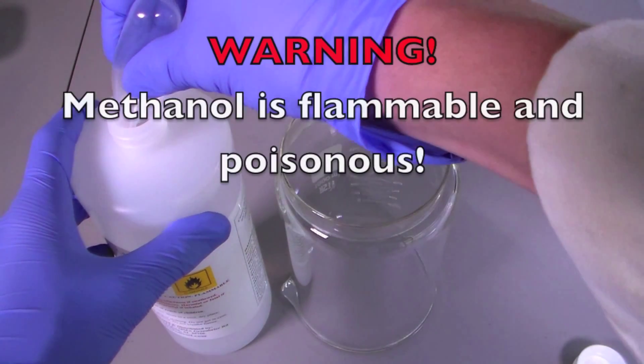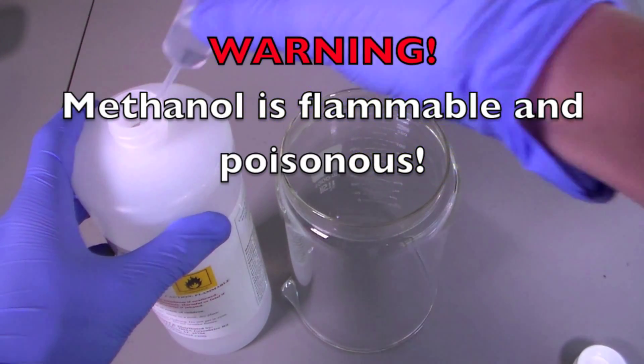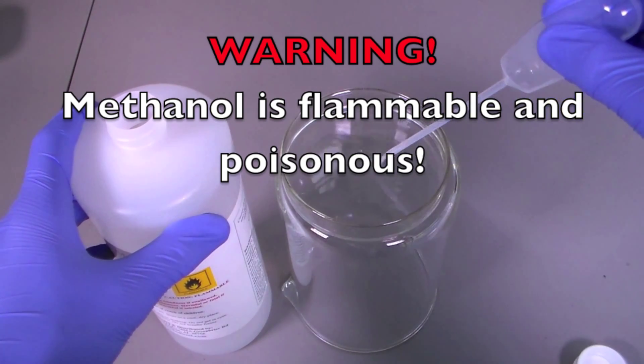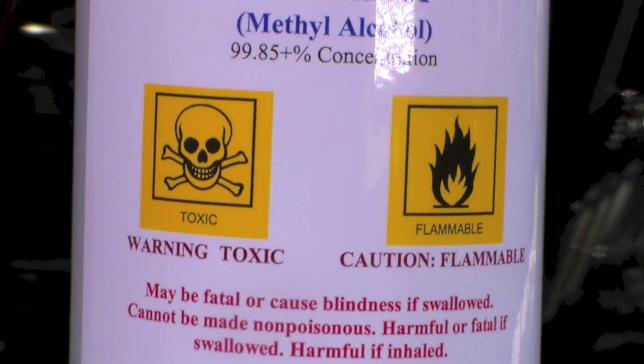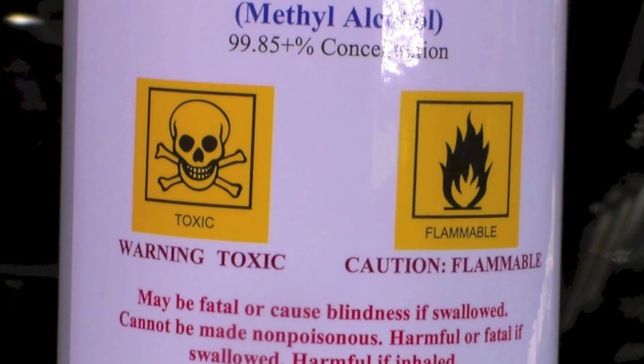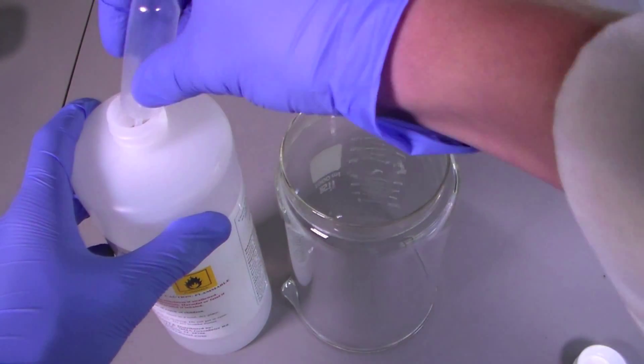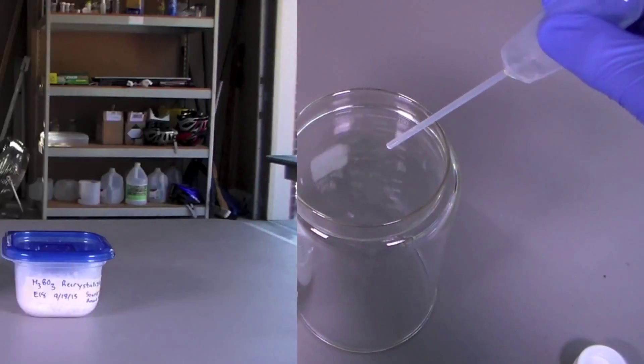This is a pretty simple demonstration, although it doesn't come without risk. Methanol and its vapors are very toxic and can blind or kill you. Also, methanol is a particularly dangerous alcohol due to its high flammability, so make sure you have experience with handling flammable liquids before attempting this experiment.